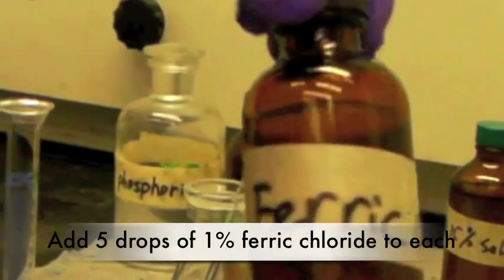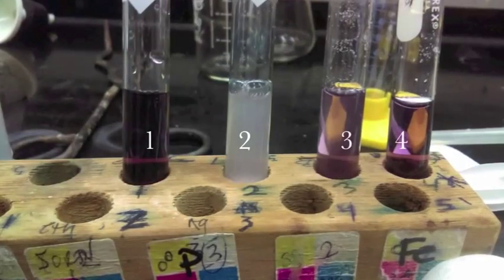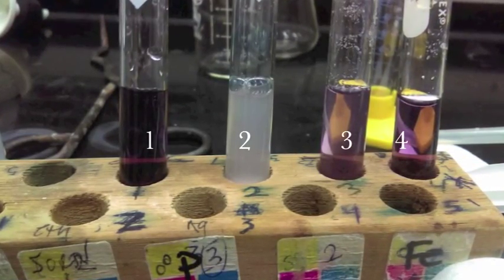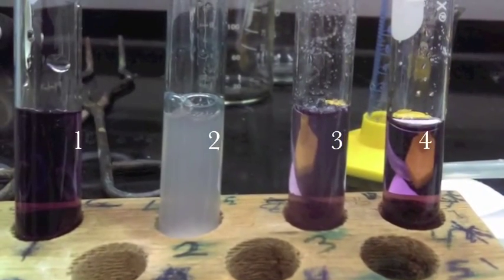Add 5 drops of 1% ferric chloride to each test tube. Ferric chloride is a purity test. It tests for the presence of salicylic acid.